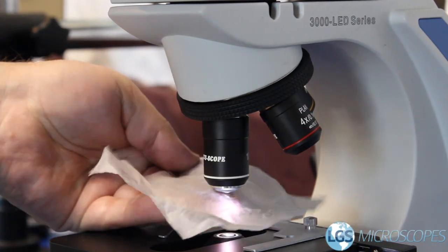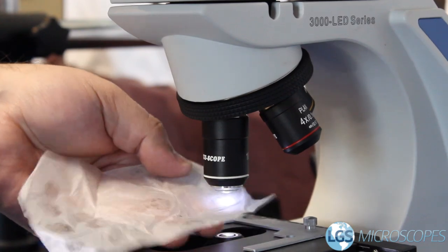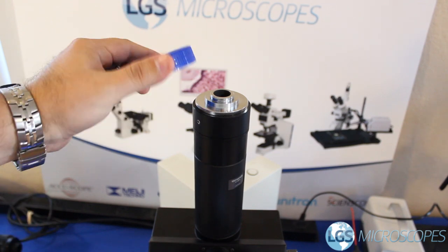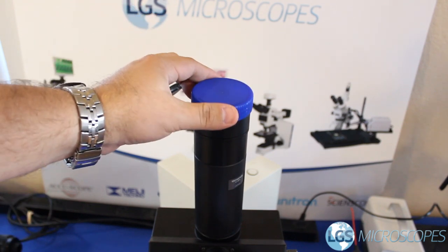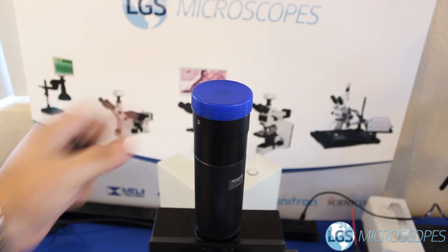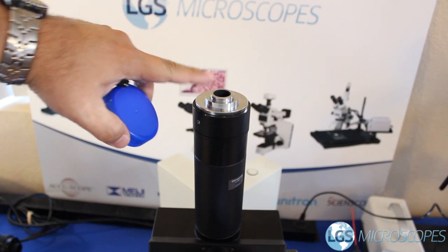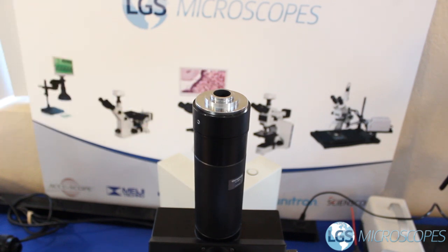You can check out our video on how to properly use immersion oil to see what I'm talking about. If your microscope has a camera port like this one does, you want to keep that covered if there's no camera on there. You can find something laying around and just set that on top, and you can also tape it down to make sure it doesn't fall anywhere. You really don't want dust getting inside this hole otherwise it'll show up really clearly in your field of view.